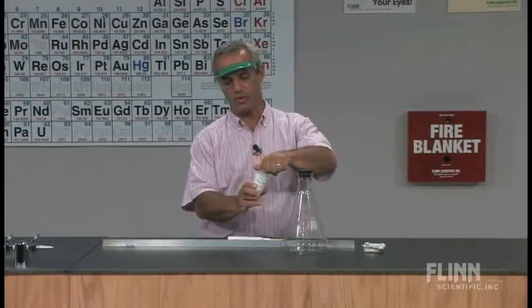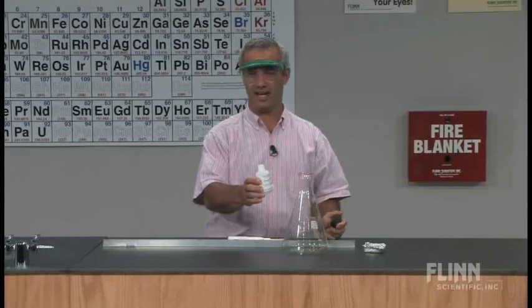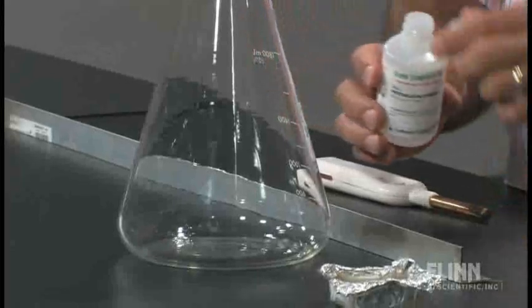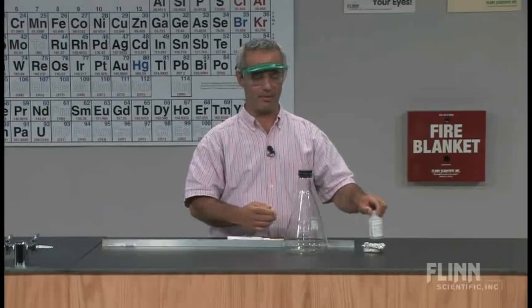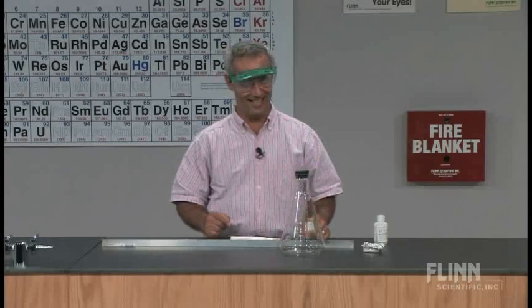The liquid is petroleum ether. Not regular ether, but petroleum ether, which is really just a mixture of pentane, hexane, heptane. And I'm going to pour maybe about 5 milliliters of it in this large flask. It evaporates pretty quickly and builds up a vapor pressure. Sometimes it's enough to even make that little stopper go popping out of there. Yep, see?